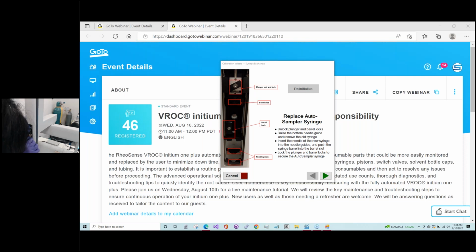You're a little heavy-handed. It'll resolve itself once you complete the exchange wizard. It'll reposition. You don't have to worry. It'll take care of itself. That's what I'm saying. Hole is lined up. Okay. So I think I need to make sure this is pushed down all the way. It is okay.